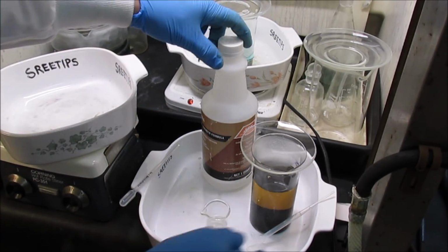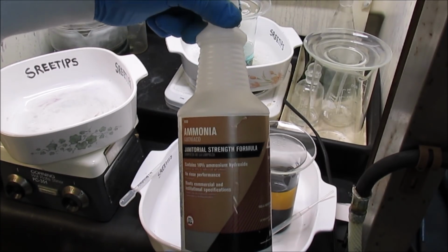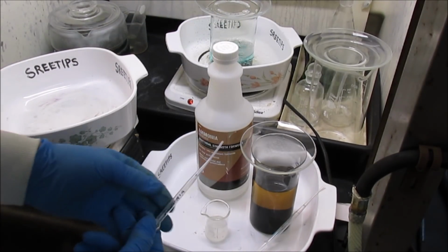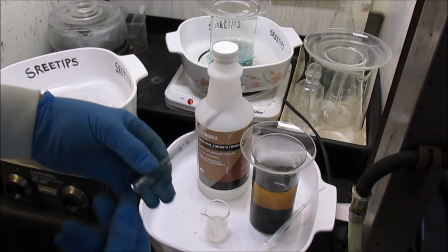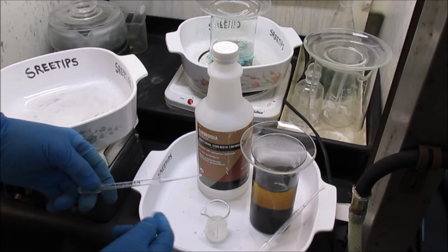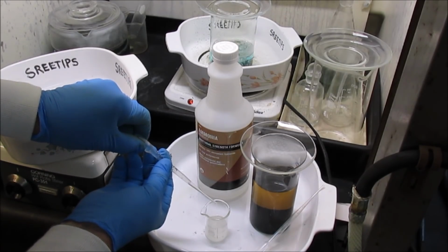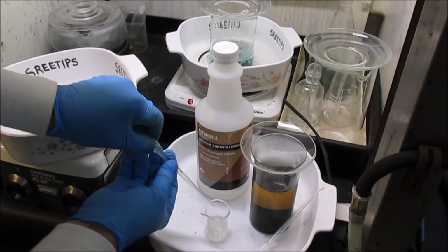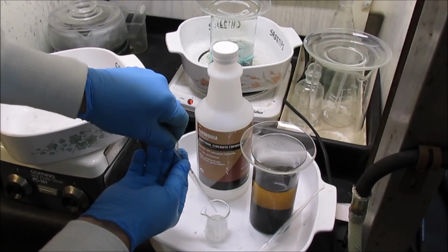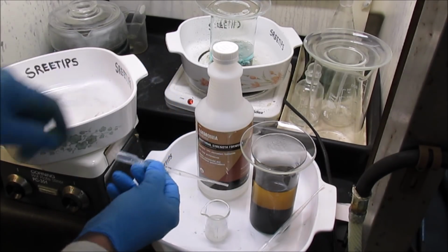And now I've got some 10% regular old household ammonia, and I've put some in this little dropper here. It's full of ammonia out of this bottle, and I'm going to add it to this solution and see if it turns it blue. If it turns blue, that means I got copper in solution. And there it goes. I see a little bit of blue color going on there.